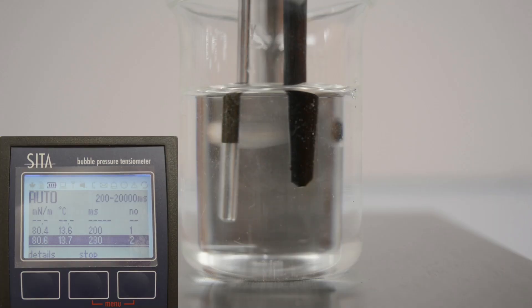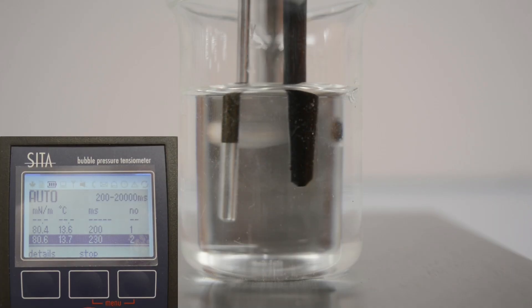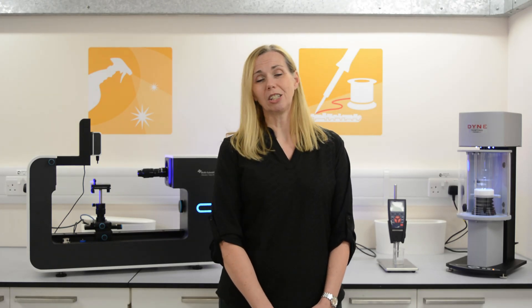A bubble tensiometer will measure the pressure required to form and maintain a bubble at the tip of a capillary which is immersed in your liquid. This will provide dynamic surface tension data.